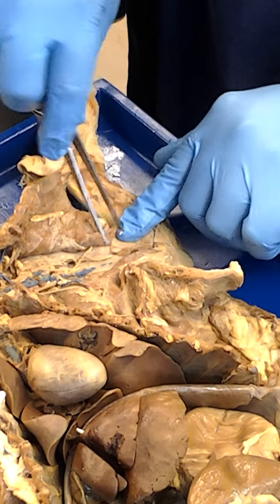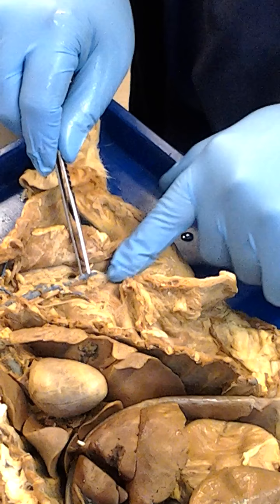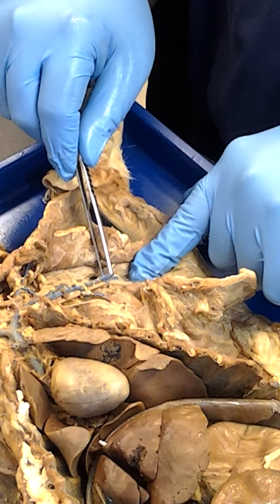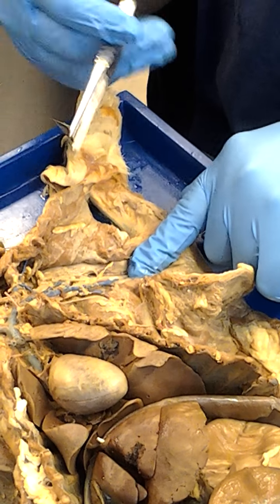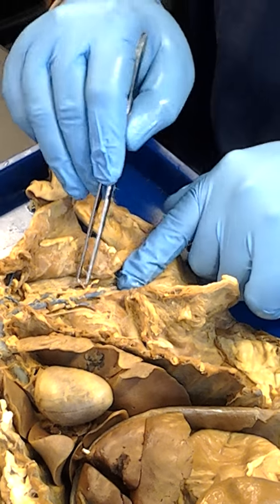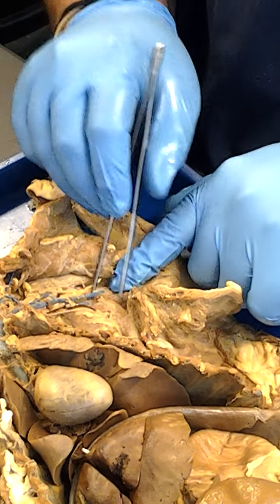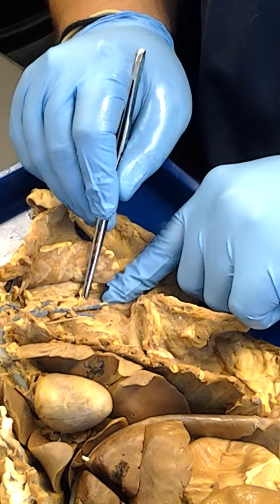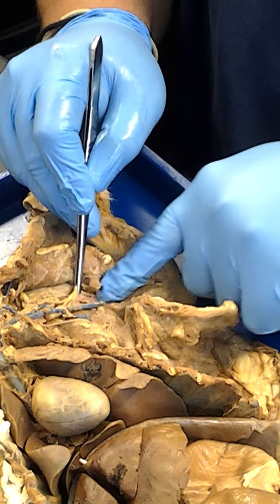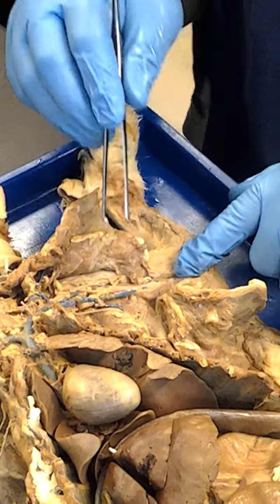does not go into the arm. This one does. This one that goes into the arm is going to be the what? The brachial. Fantastic, because arm is brachial, remember? So this is the brachial vein, and of course the blood vessel next to it is the brachial artery, which is right there. So there's the brachial artery right there, and it heads into the arm.